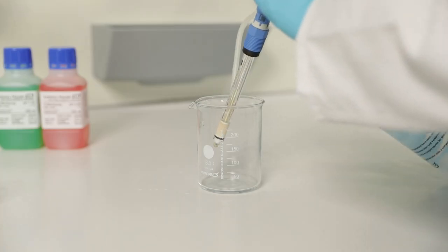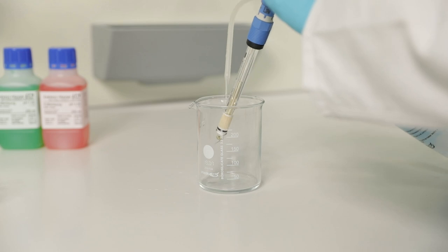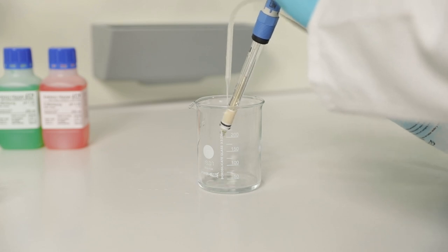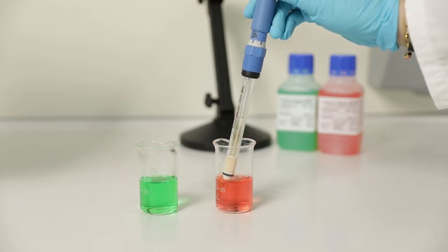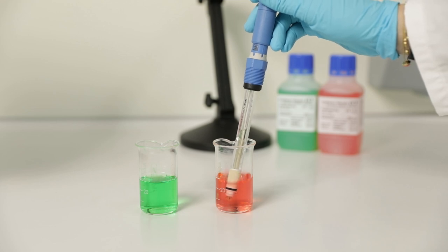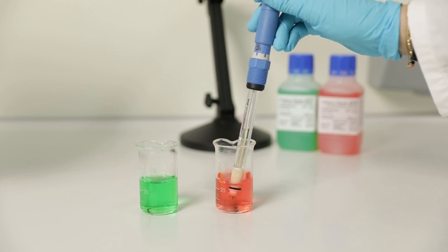If OK, rinse the sensor with clean water. Then put the sensor in the second buffer solution requested from the CM44, by default pH 4.